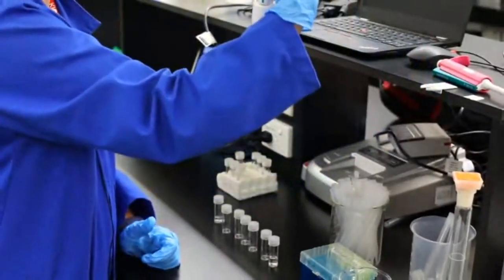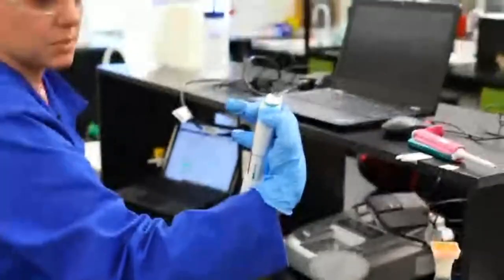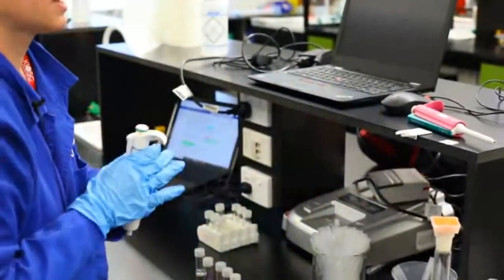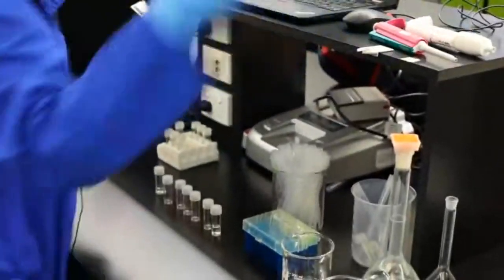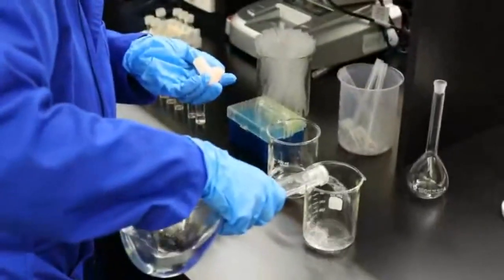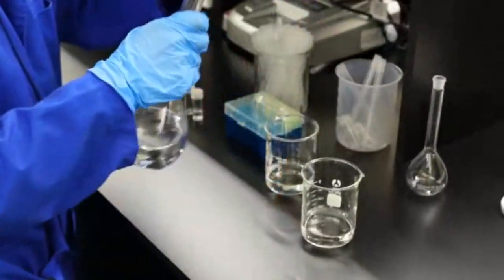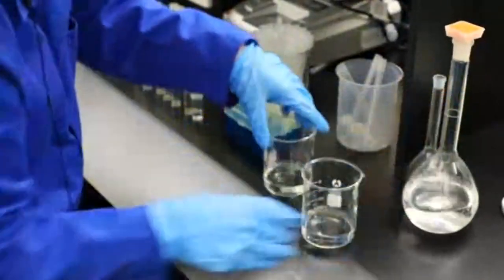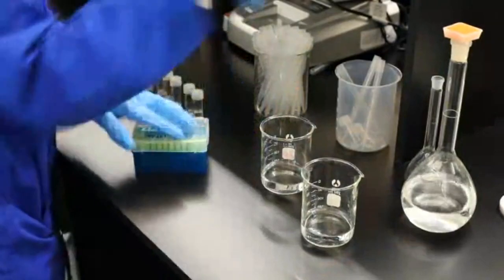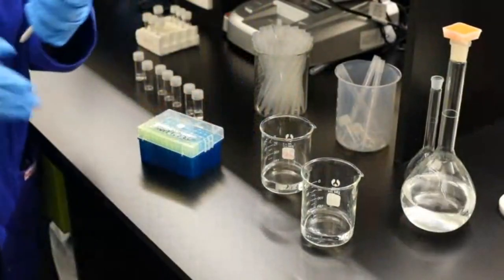on the side here. I can get it in the camera. There we go. And you simply eject it there. So for our next one, we need to be using our stock solution, which ET made for me beforehand. And you'll see that I have both my beakers labelled. Because it's clear liquids, you need to make sure you are labelling everything, otherwise it gets a bit confusing.